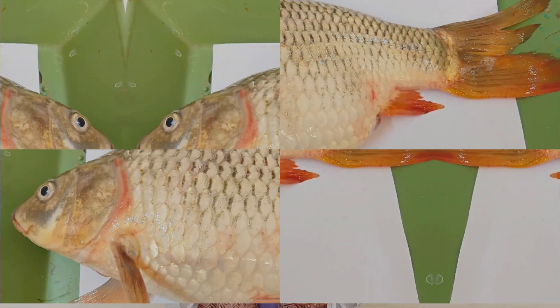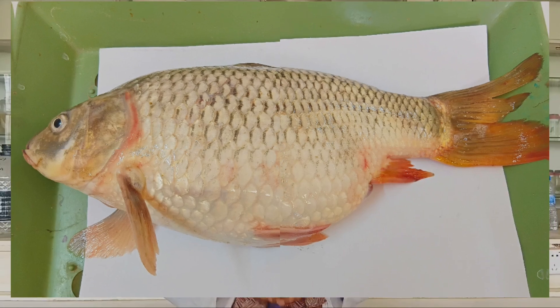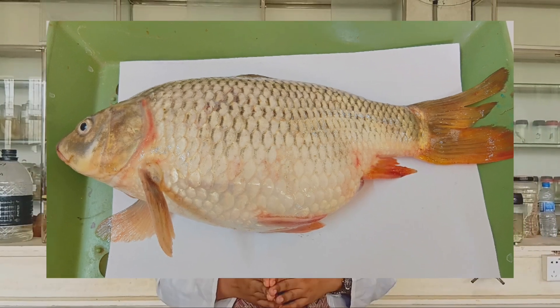The materials that we use for estimating the fecundity of our fish are as follows. First of all, we need a mature female fish in the spawning or pre-spawning stage. For equipment, we use an analytical balance, tray, dissecting instruments, pipette, measuring cylinder, lab coat, and gloves.